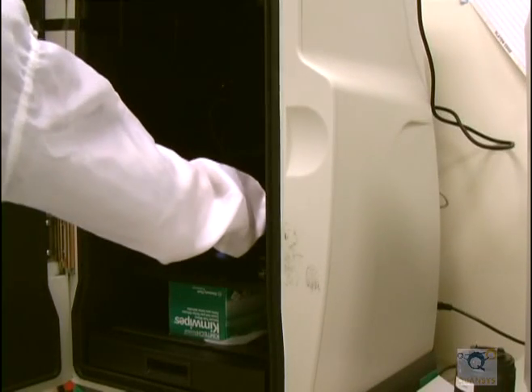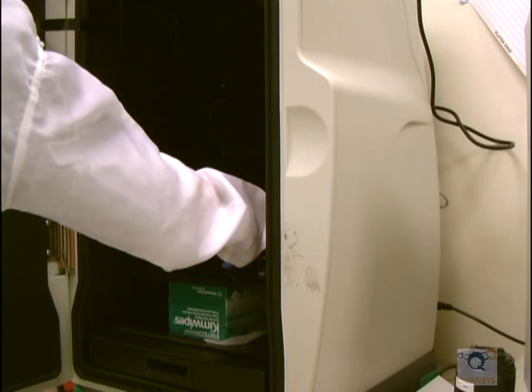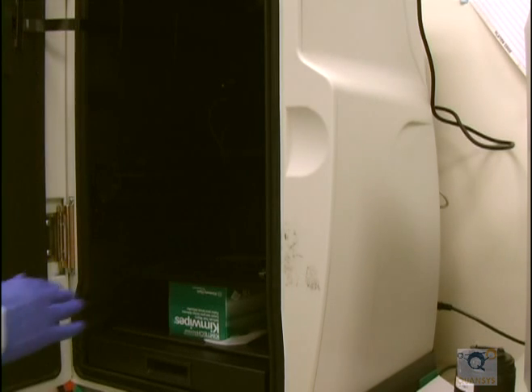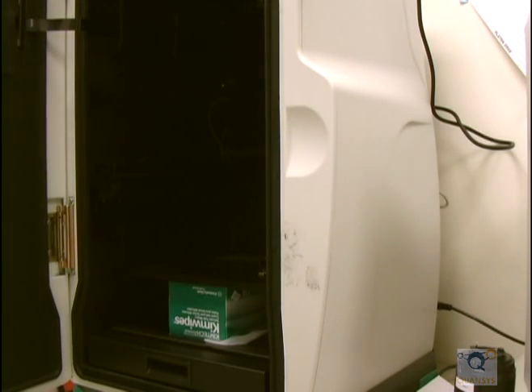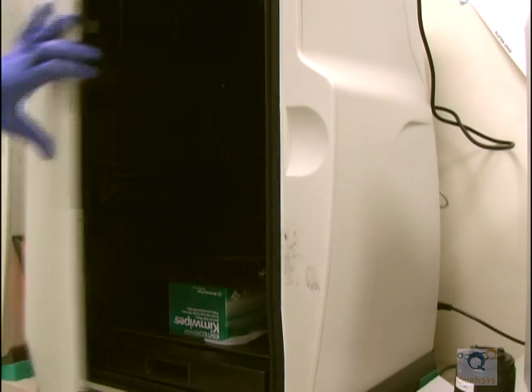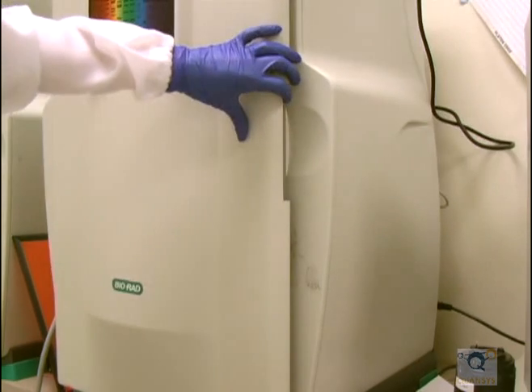Replace the imaging target sheet with the plate and ensure the plate is centered in the imaging screen and that it is straight. Close the cabinet door.